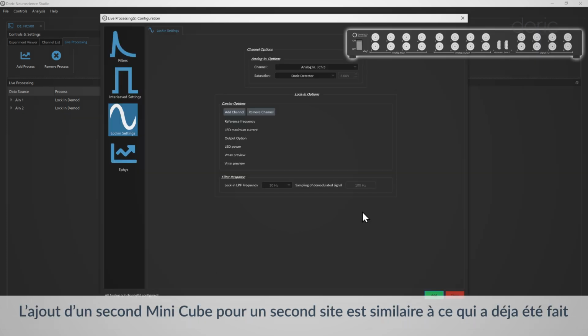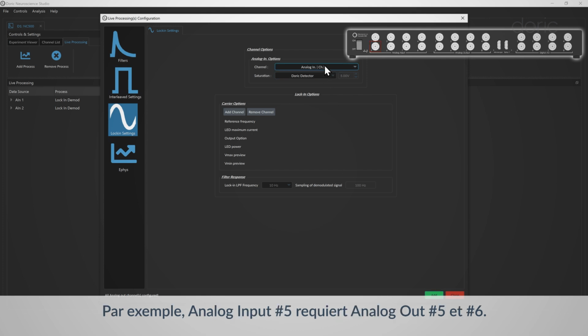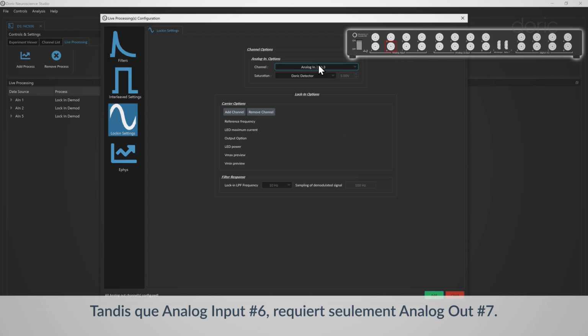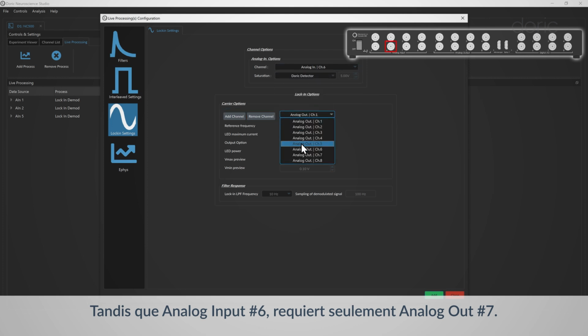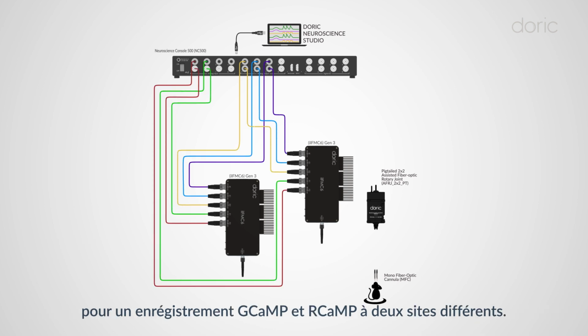Adding a second minicube for a second site is similar to what we've already done, but analog in and analog out numbers will be different. For instance, analog input 5 requires analog out 5 and 6, while analog input 6 requires only analog out 7. We've finished the lock-in configuration with 4 input channels for a GCaMP and RCaMP recording at 2 different sites.